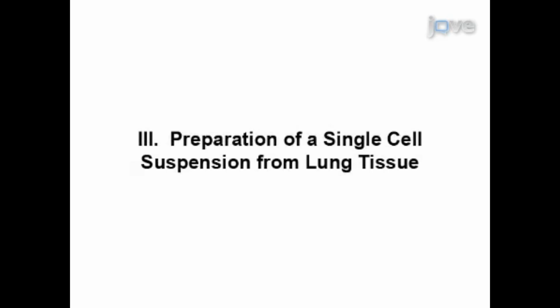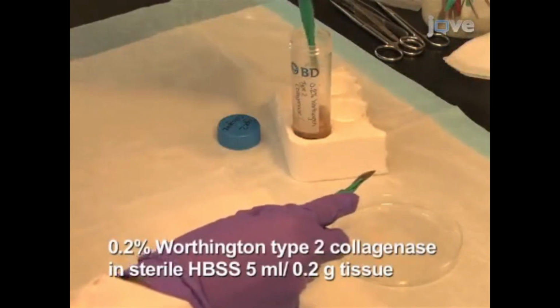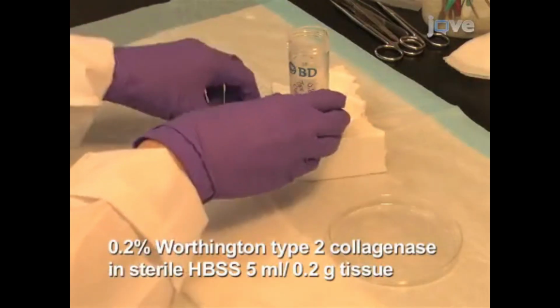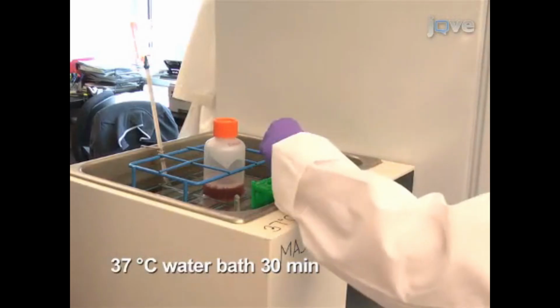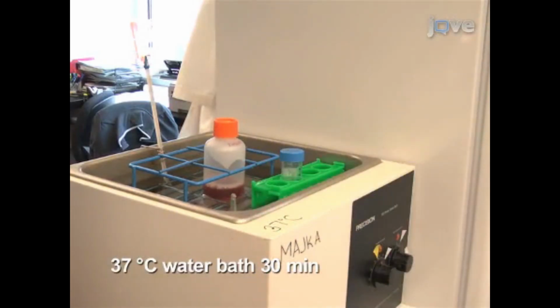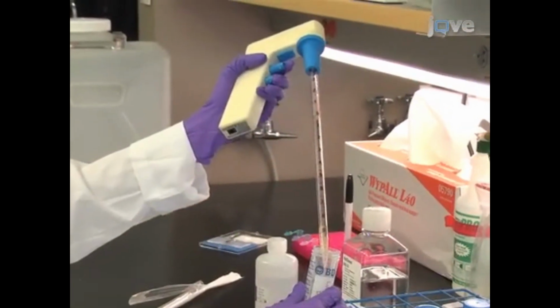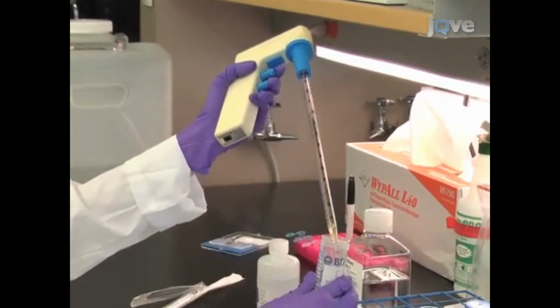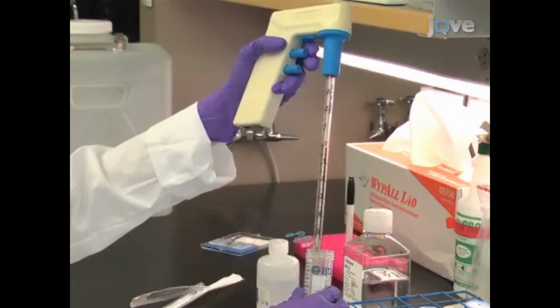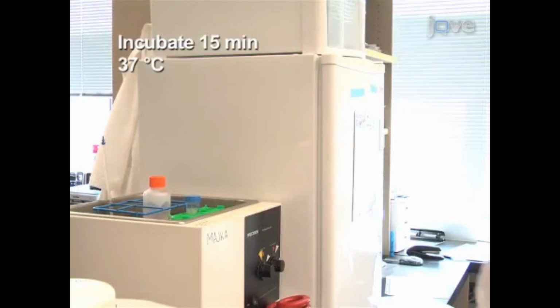Next, a single cell suspension of lung tissue will be generated from the isolated tissue. Place each lung in a tube containing pre-warmed 0.2% Worthington type 2 collagenase prepared in sterile HBSS. Then immerse the tube in a 37 degrees Celsius water bath and incubate for 30 minutes. Following the incubation, use a 10 milliliter pipette to triturate the sample until the digest flows easily through the pipette, approximately 10 repetitions. Incubate for an additional 15 minutes at 37 degrees Celsius to complete the tissue digest.